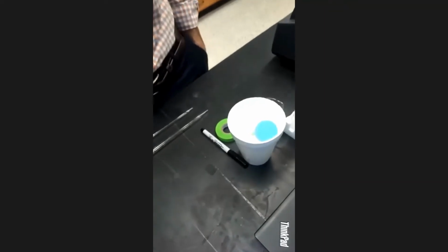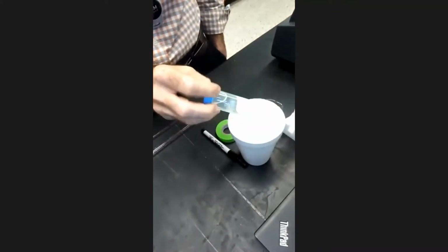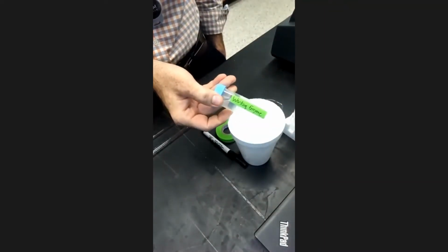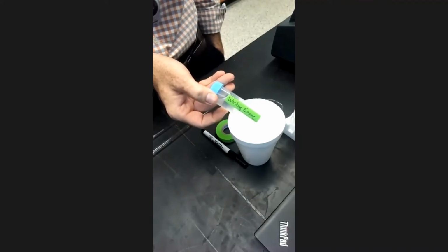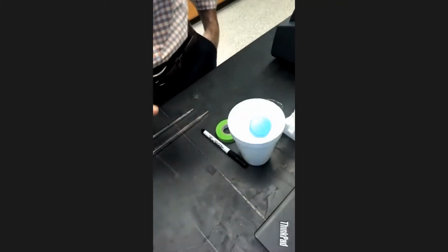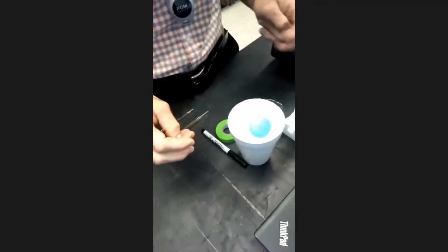We also have over here on ice our working enzyme. This is the enzyme, the beta-galactosidase, which we will also be adding into the tubes. The first component that we'll actually be adding into the tubes, though, is a reaction buffer. So I'm going to take you over to the hood where the reaction buffer lives and show you that.